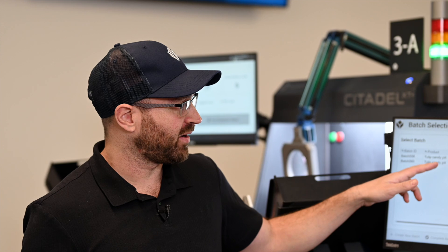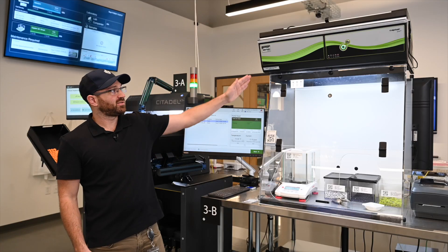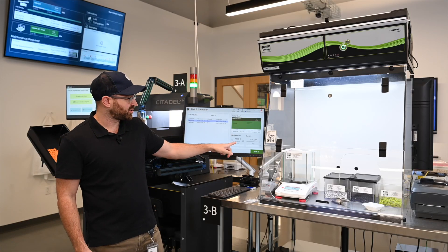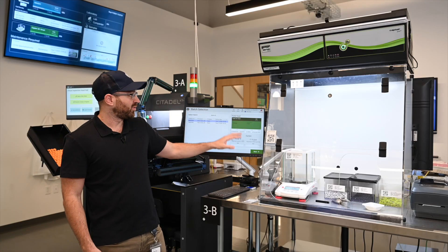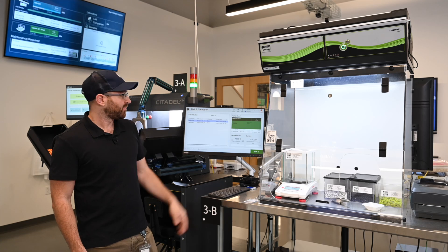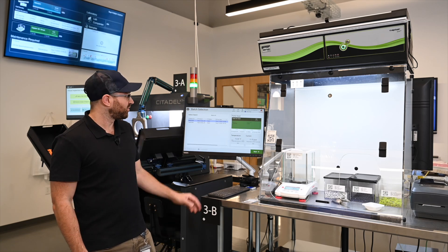Right here you can see we have a couple of batches available for the operator to choose from. I'm going to select one and begin the weigh and dispense operation. I'm connected directly to this hood here, pulling in temperature and current, which indicates that my fume hood is running. This is part of the machine monitoring feature set within Tulip.